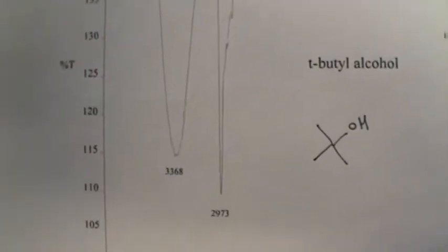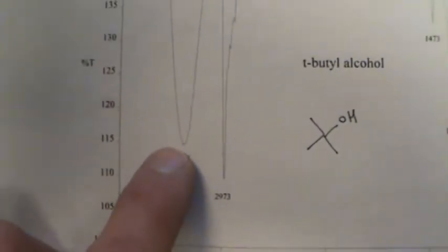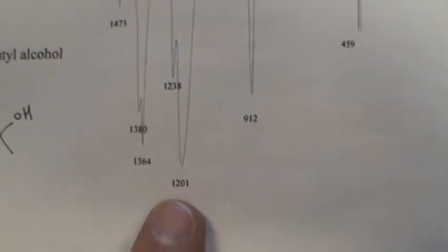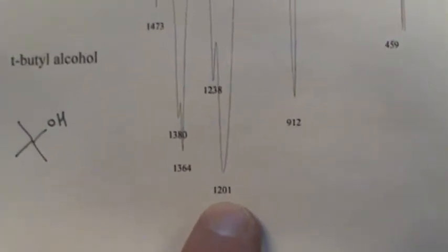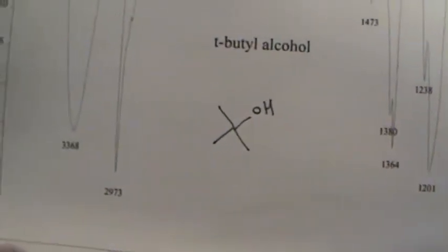And to be honest, folks, this is the spectrum that I obtained for it, 3368. The point is that big absorption here obviously is the OH stretch. The corresponding CO stretch, that book was saying 1150 for a tertiary. Now it's interesting, there's absolutely nothing here. So by default, this stronger absorption here is going to be the CO stretch. So that takes care of the 2 main absorptions for that.